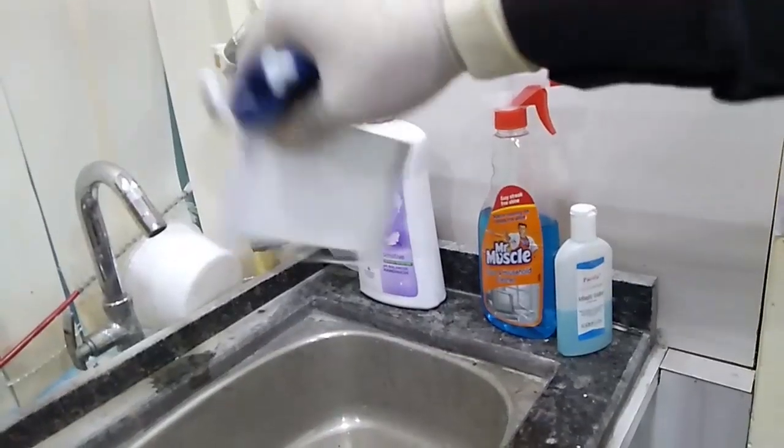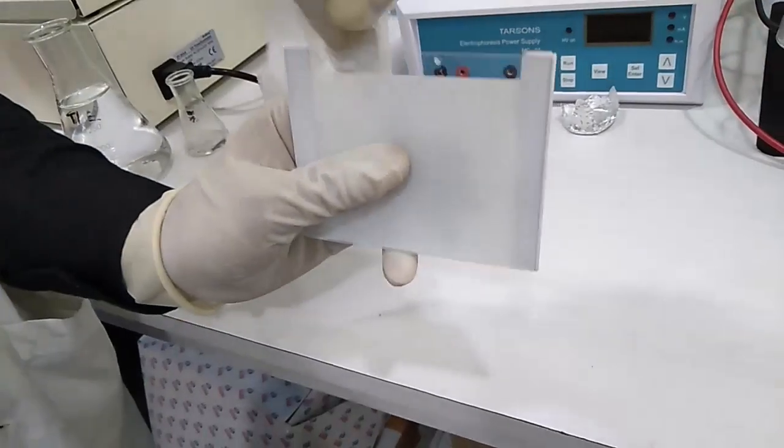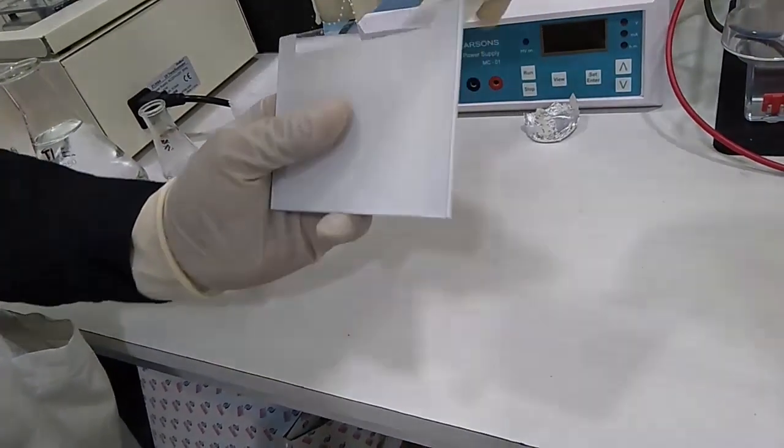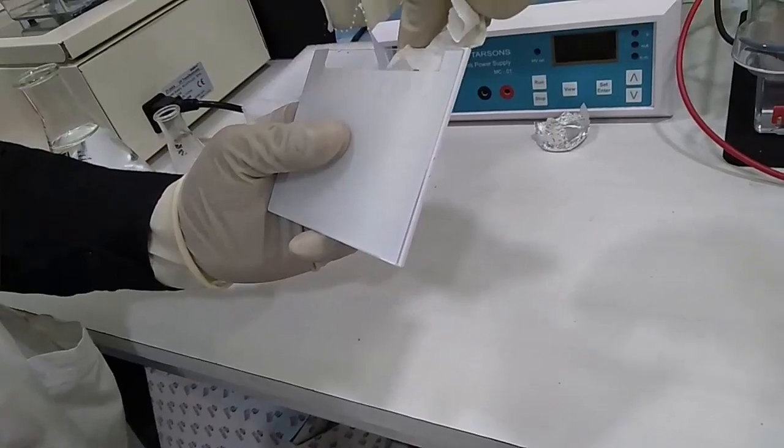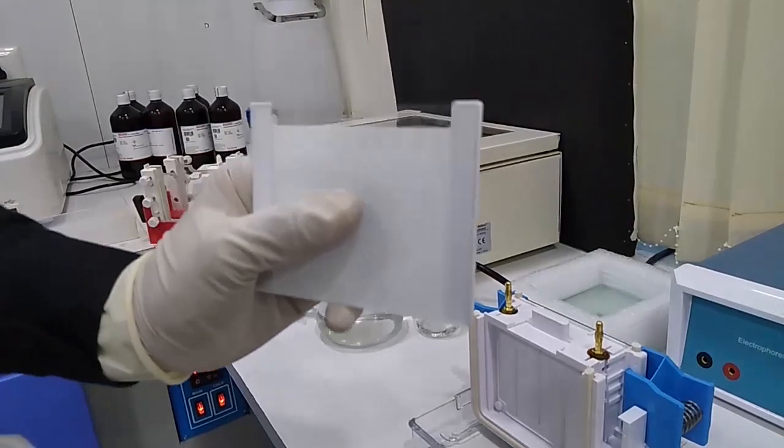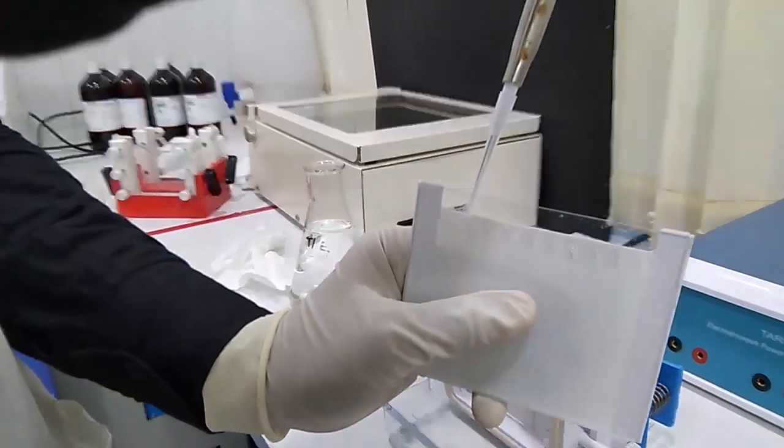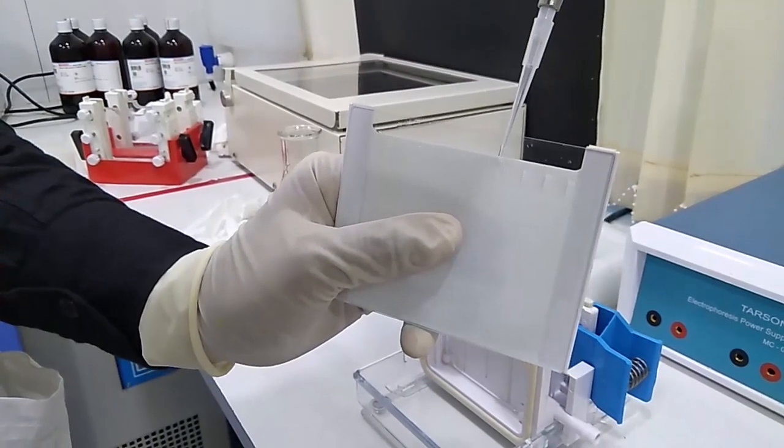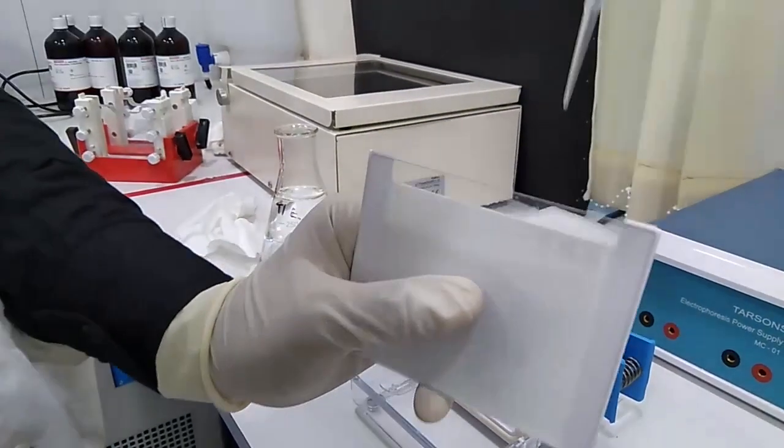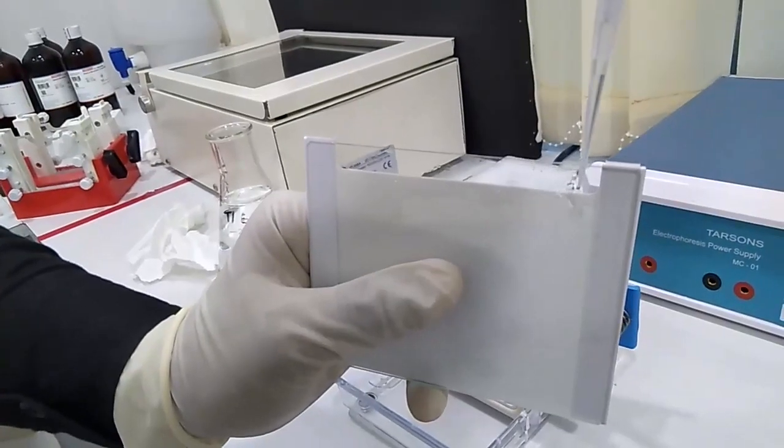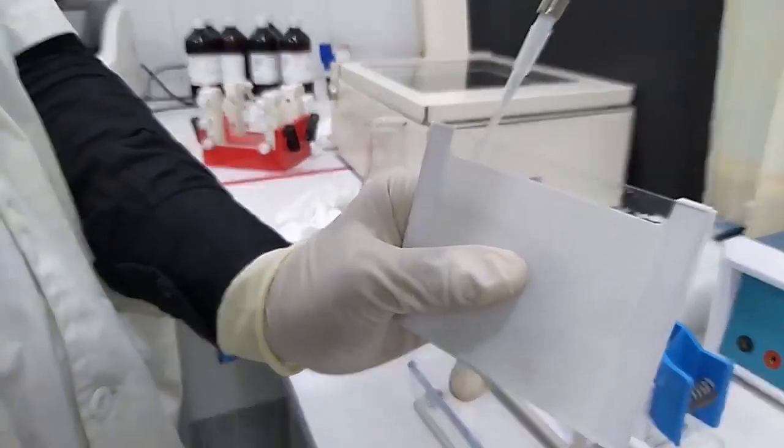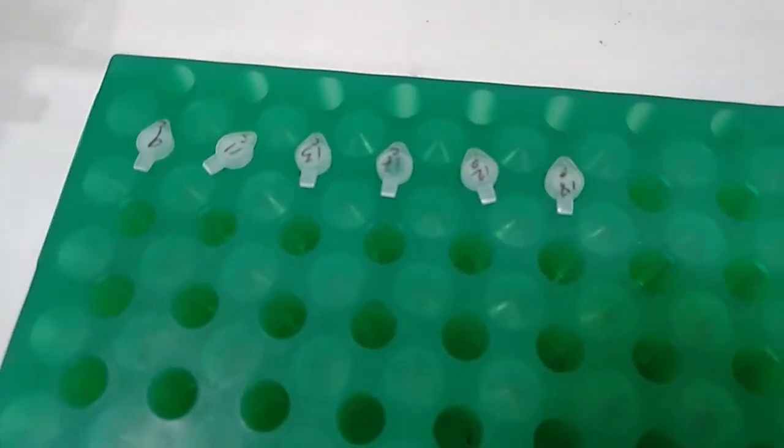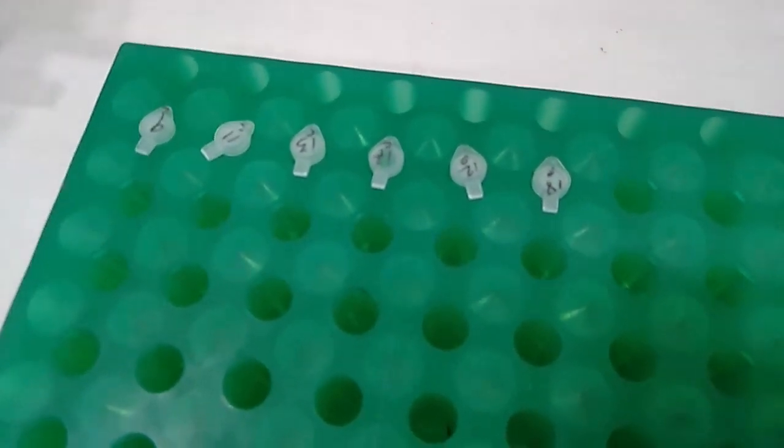Discarding it. Washing it carefully and by the tissue paper make sure that there is no remaining buffer. Now loading the buffer again to the wells. There are c-kit and PDGFRA samples are there. Now we will load the sample into the gel.